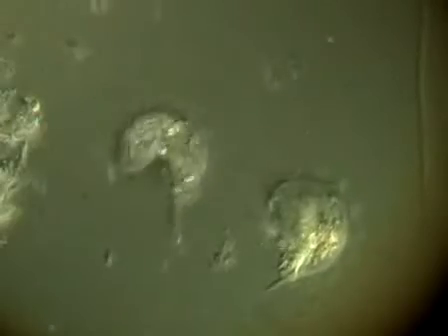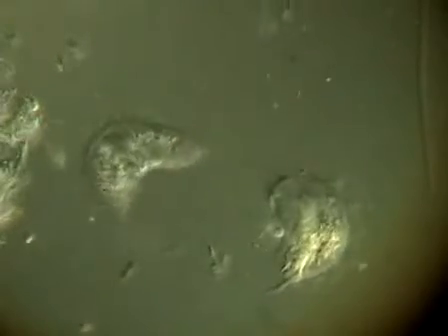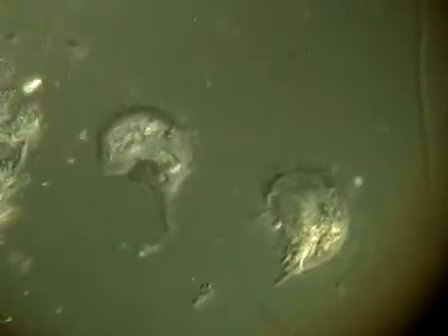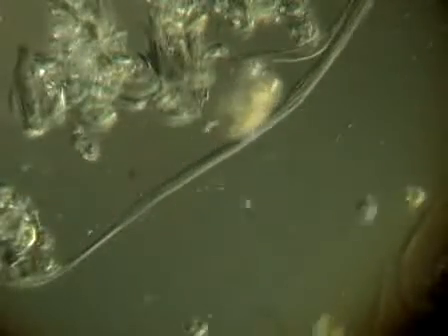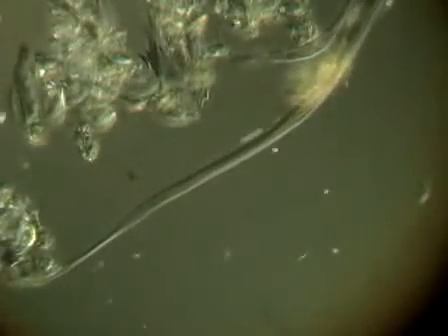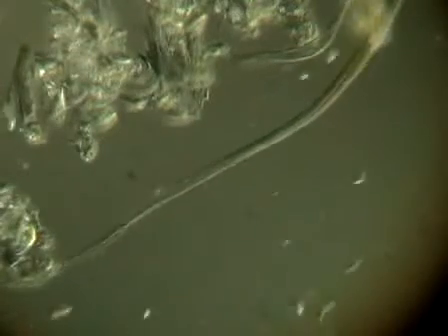Whereas with some of the other protozoa you can see that they've engulfed wood particles into the cytoplasm, there's no evidence that these are engulfing wood particles. So you can't even really say that they're degrading wood. I don't know that they're degrading wood at all. More possibly, they're positioning these bacteria somewhere in the gut so the bacteria can do something and perhaps feed the protozoan.